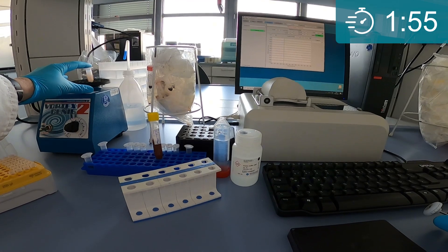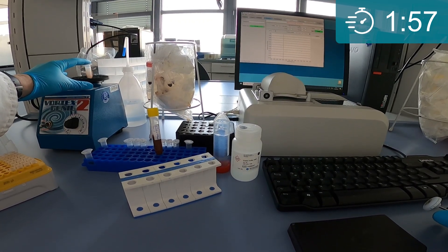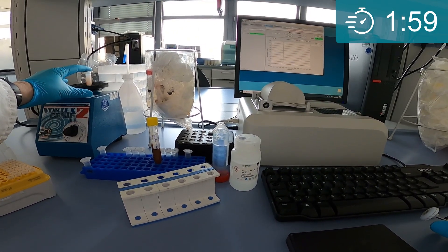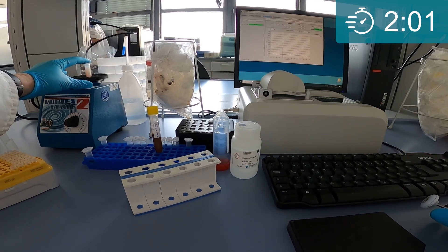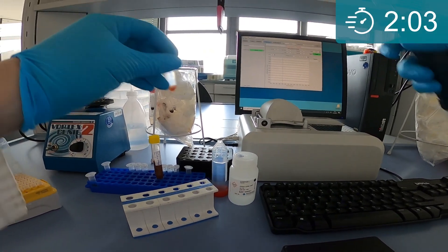The water wash is environmentally friendly and the beads don't need to be dried before the elution step. The DNA won't come off during the wash process.